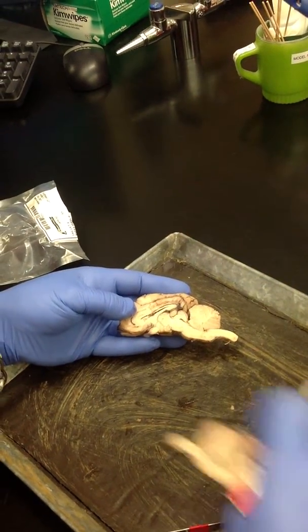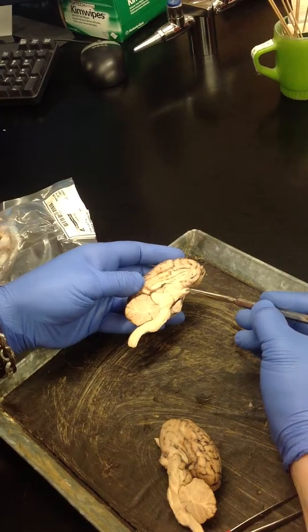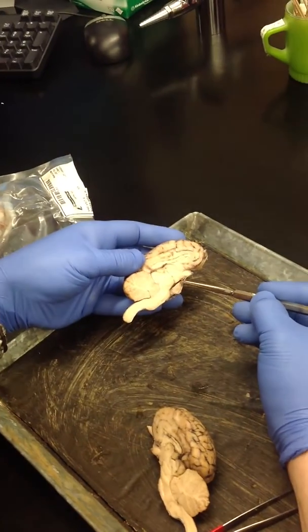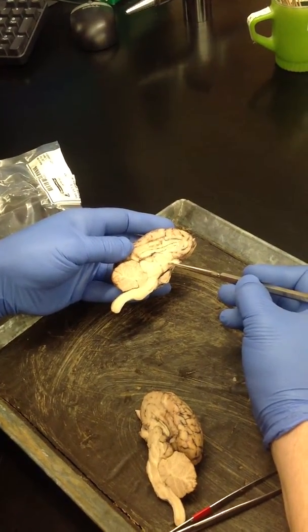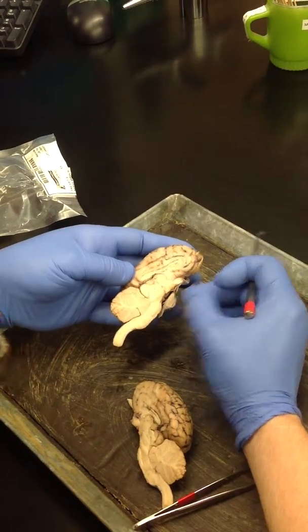And you can see that on this side better. So let me come back here. We've got optic nerve, optic chiasm. We're in the hypothalamus right here. There's our mammillary body, and there's our pituitary gland hanging off of the hypothalamus. Is that the infundibulum? Yeah, you really can't even see it, it's so hard to see on this.